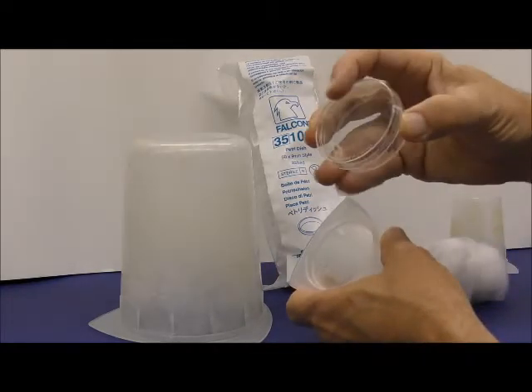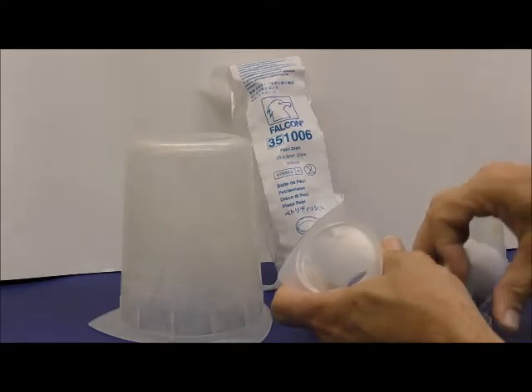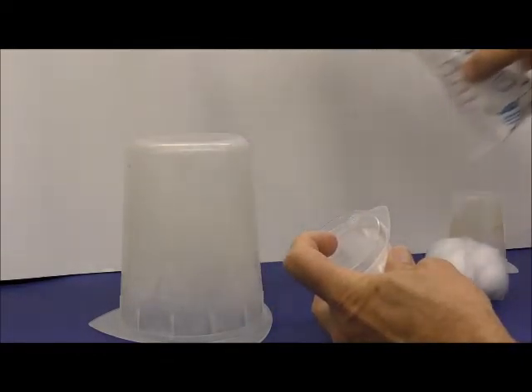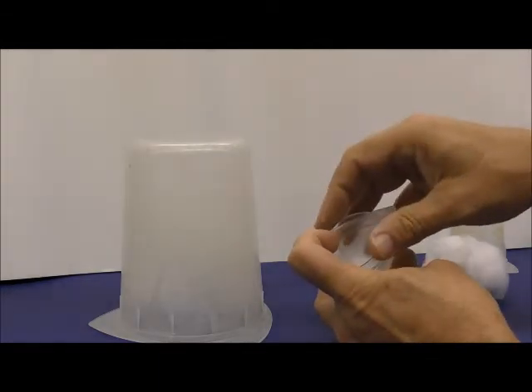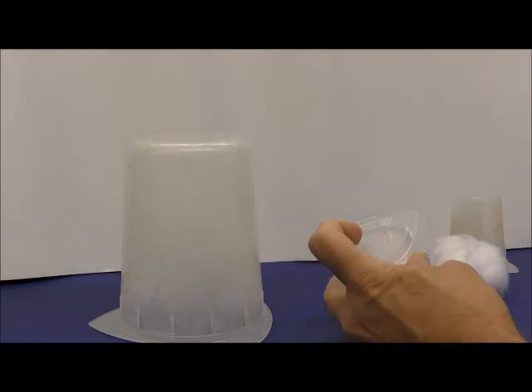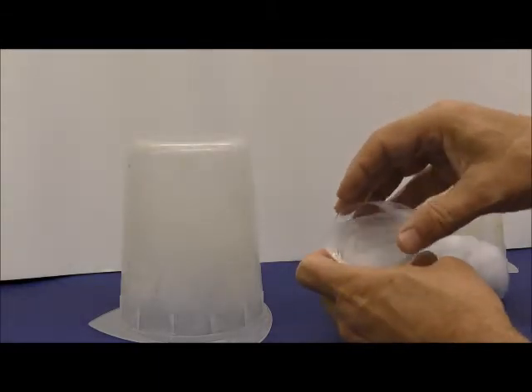I think with these other petri dishes, the lids can work relatively well. You just have to be really careful about getting the right connection when you make them. Okay, so that's for this.